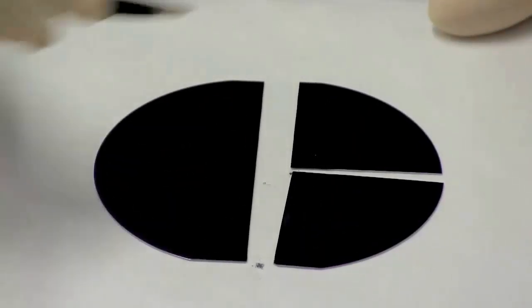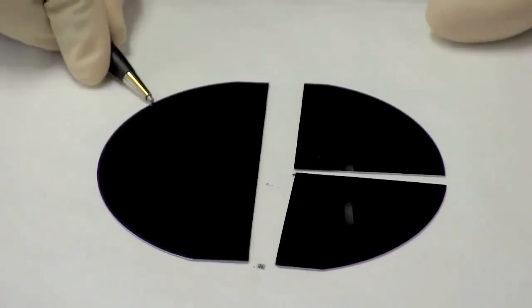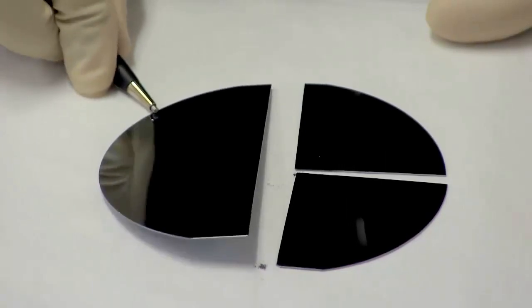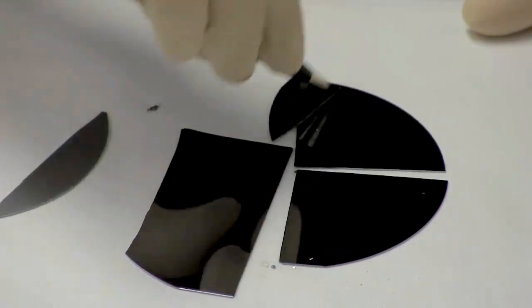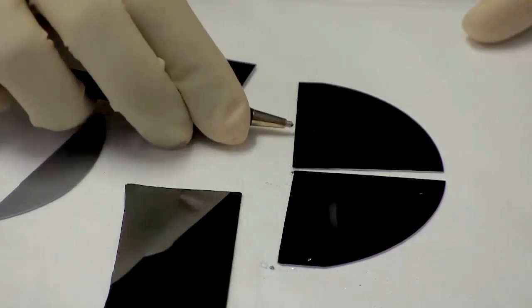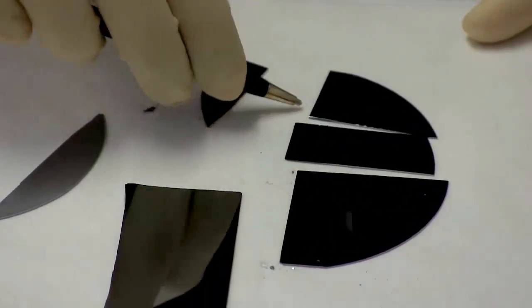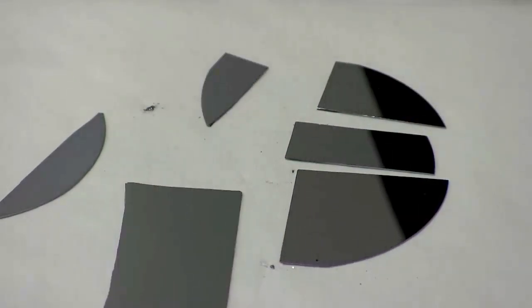You want to go along the crystal planes — you don't want to go off at some weird angle like you're trying to cut a piece of pie, because most likely you'll end up with something that shatters into a lot of different pieces. So go along one of the crystal planes and with even pressure, cut it like that. This is one method of doing it and you need to practice.